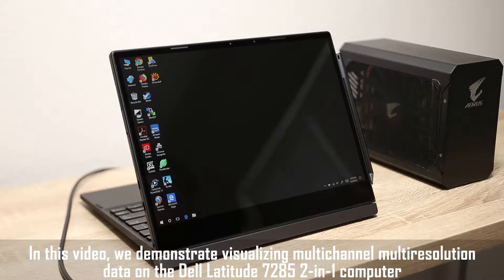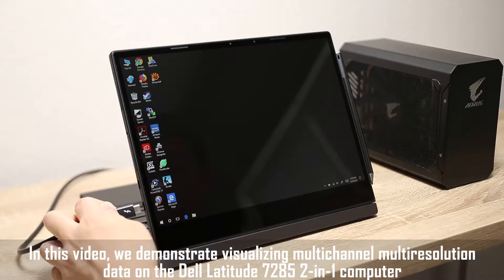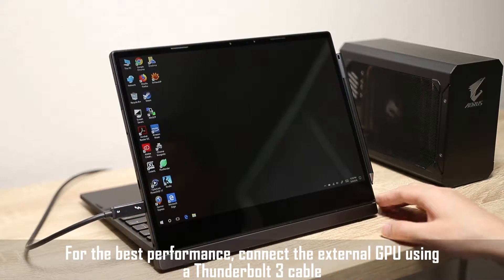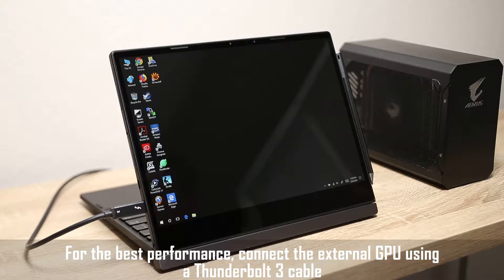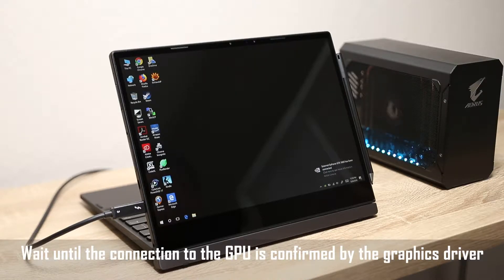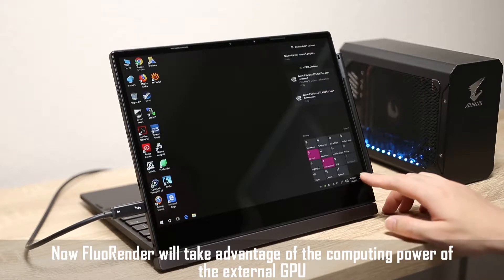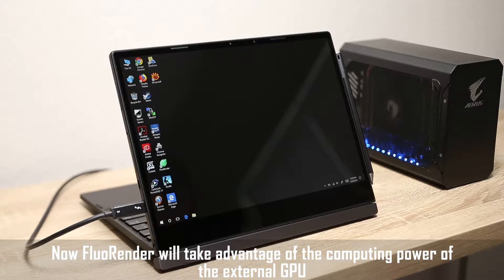In this video, we demonstrate visualizing multi-channel multi-resolution data on the Dell Latitude 7285 2-in-1 computer. For the best performance, connect the external GPU using a Thunderbolt 3 cable. Wait until the connection to the GPU is confirmed by the graphics driver. Now FluoRender will take advantage of the computing power of the external GPU.